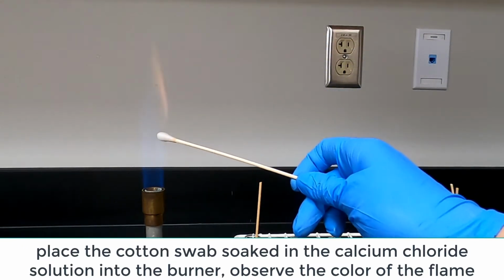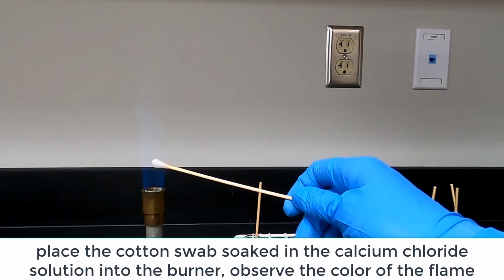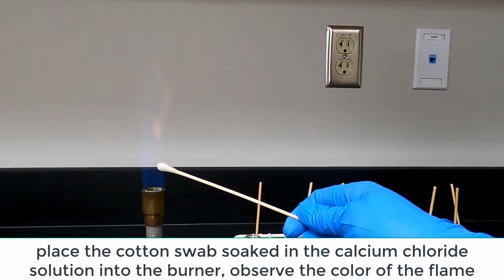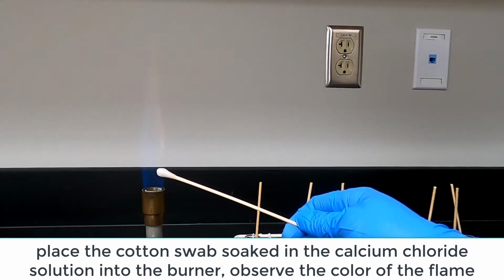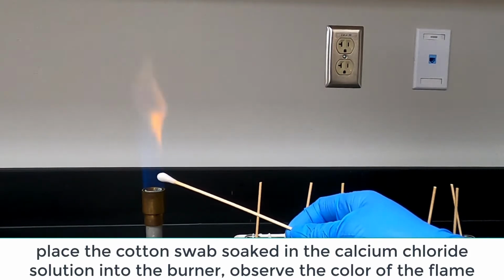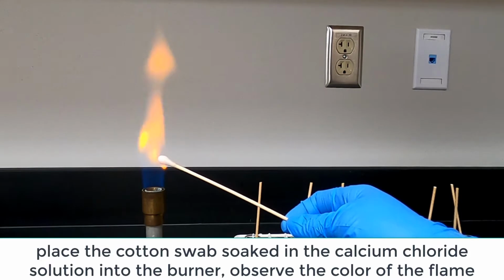Calcium chloride, record your observations on the datasheet.